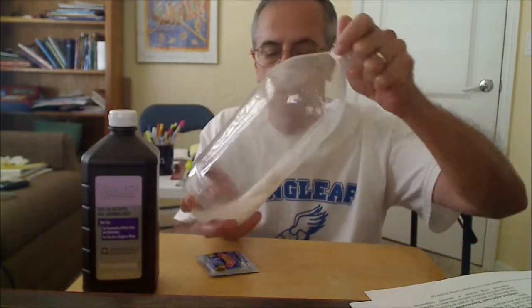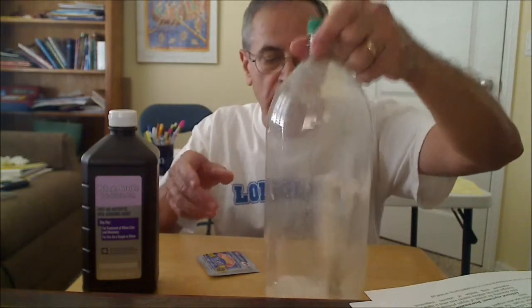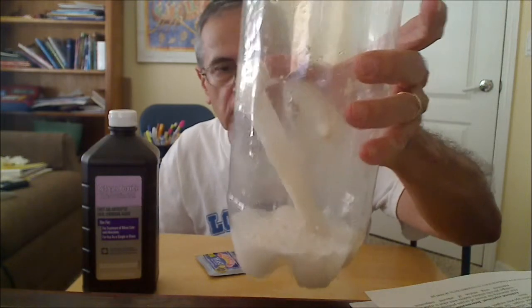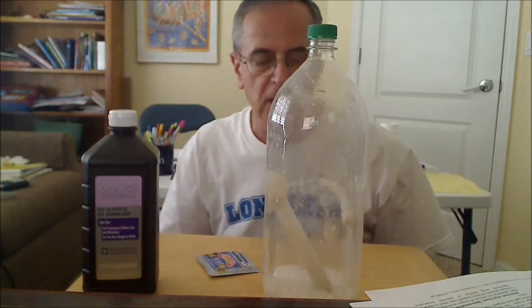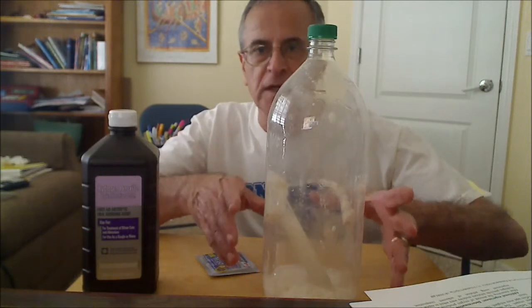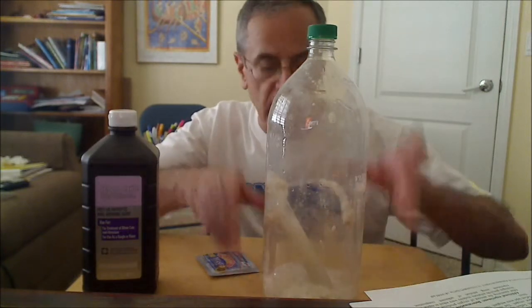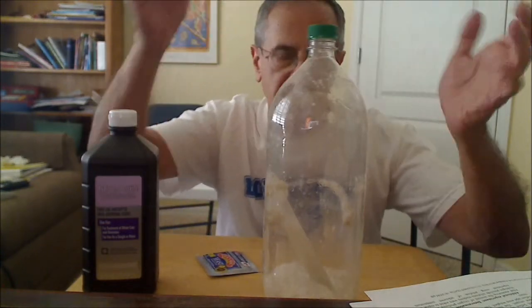Okay, so let's start the reaction. You can see a lot of bubbles forming. Okay, I can hear the sound of the bubbles. And it really won't build up much pressure, but one could demonstrate that the mass doesn't change when you keep the cap on very tightly. There might be a slight leak, so you have to be careful.